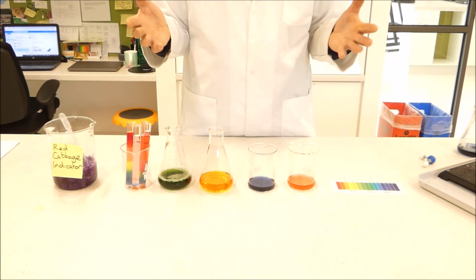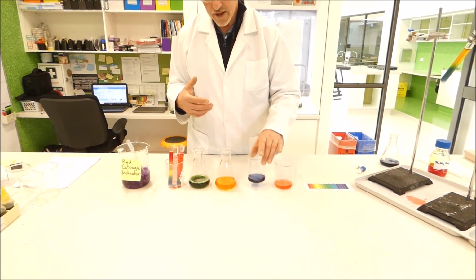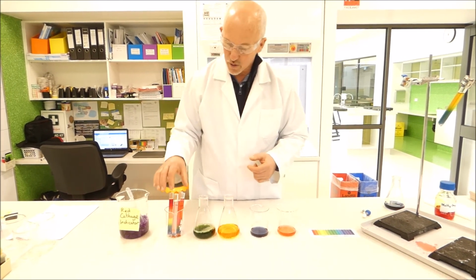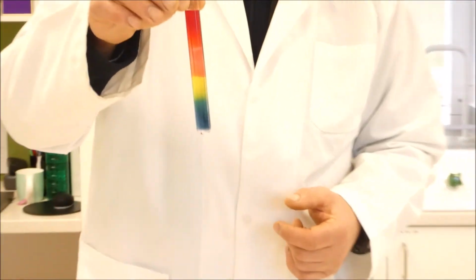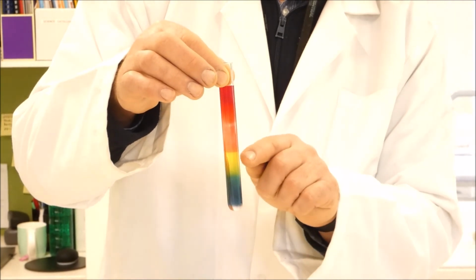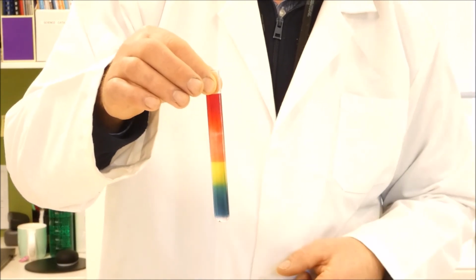So in later years when you do chemistry, chemical analysis will become part of what you're doing in class. So you get a whole range of different colours forming. We won't go through all the different indicators again now, we've already done that. And we can do something called a Rainbow Fizz experiment where we can demonstrate the range of colours that an indicator can form. So this is universal indicator, going from the purpley blues through the yellows, orange, pink, and then to red. So from the base solution to the acid solution at the top.